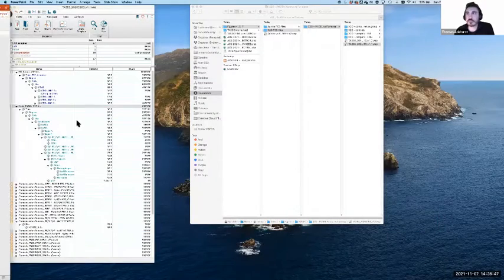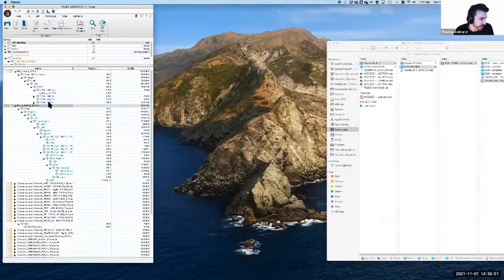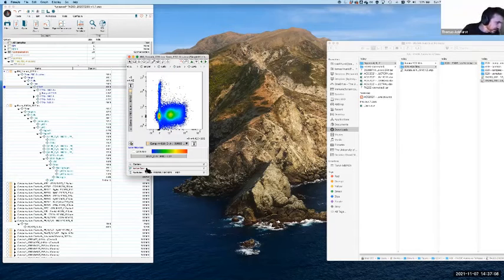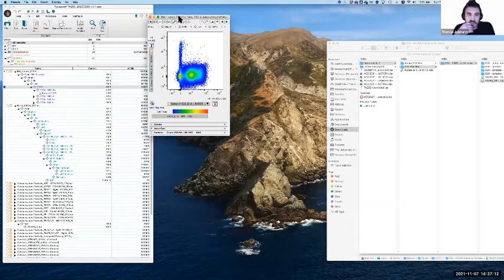All right. So what I've got here is some data and a workspace, and hopefully, so I'll update in just a second for everybody. Hopefully the resolution of this will be good enough to see. And my plot's going to open up somewhere. Yeah. So everyone's seeing, it should be up in just a minute. I think the screen sharing's probably got a little lag time, so I'll just let it catch up. Actually, you know what? Why don't we just try doing new share? Might make things a bit more efficient.